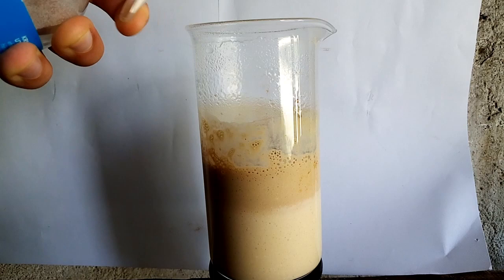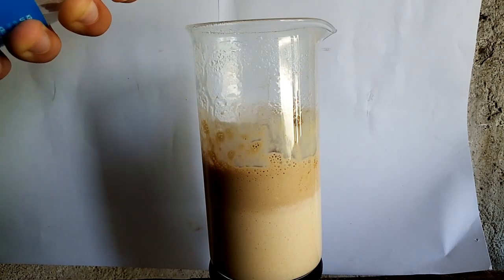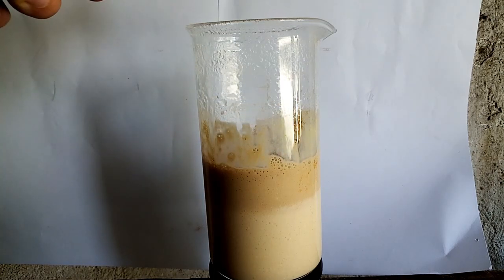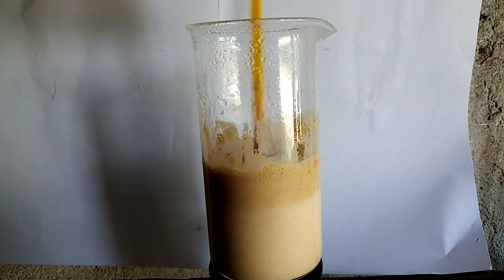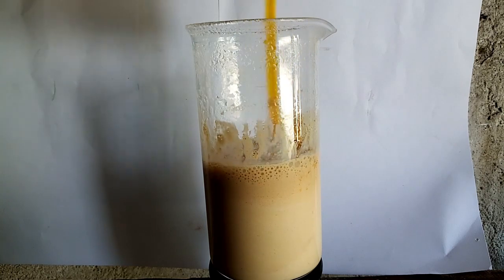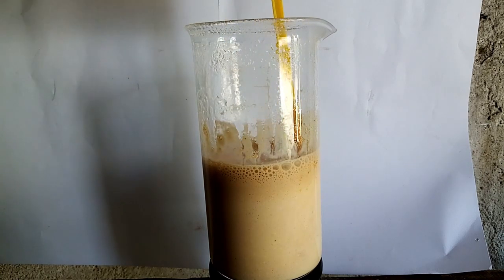After 2 hours of waiting the mixture really looked like iced coffee and I wanted to taste it, but I think it wasn't good for my health. So I spray it with some water to break the many bubbles with nitrogen dioxide that might be trapped in the calcium sulfate.